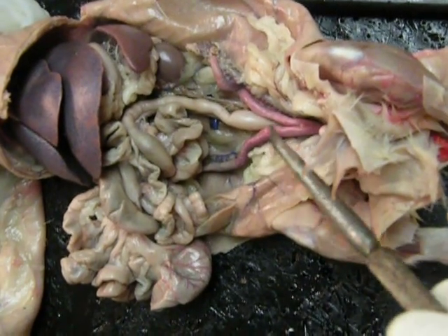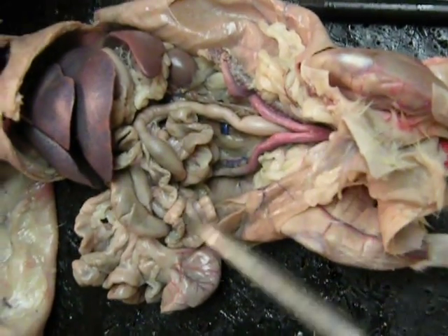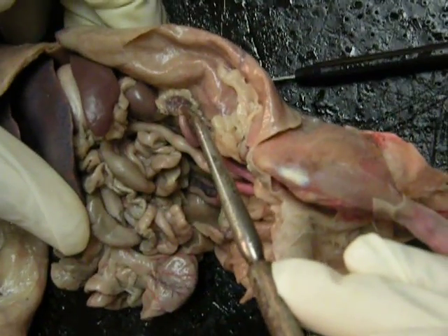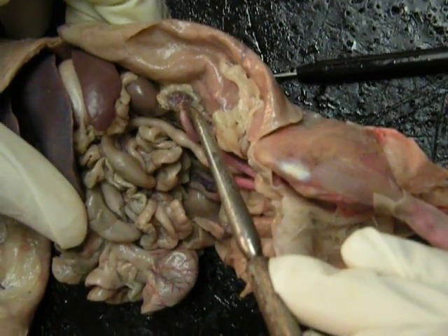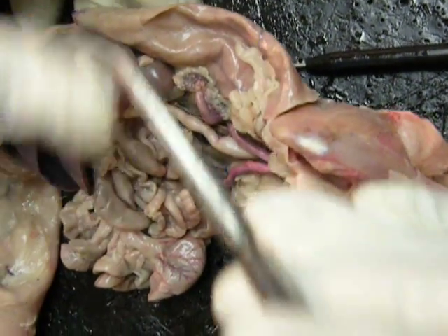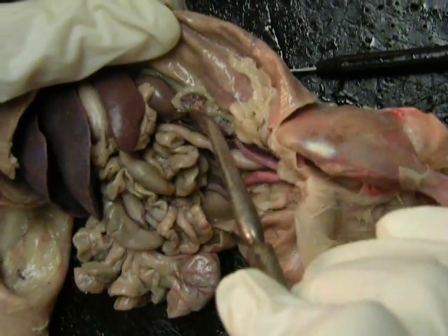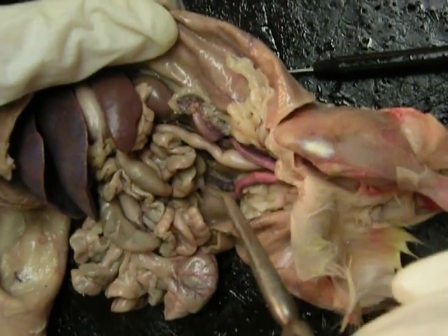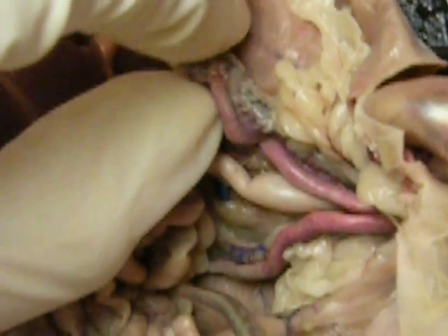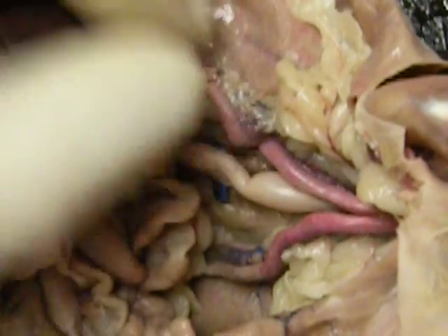This whole thing right here is called the uterine horn. Now if we follow it to the very top, there's a little curly section, and that would be the uterine tube. This whole region right here is the ovarian bursa. That's where the ovary is, and if you feel inside, it would be the follicles — it's kind of bumpy.